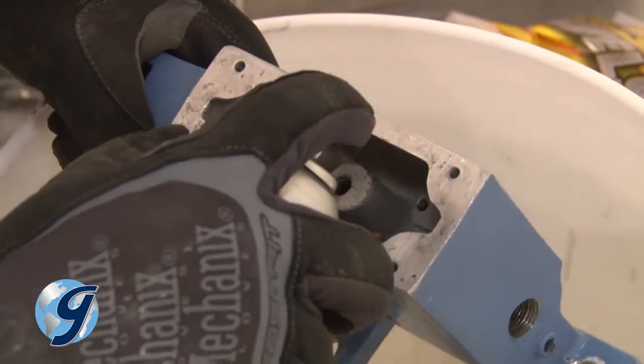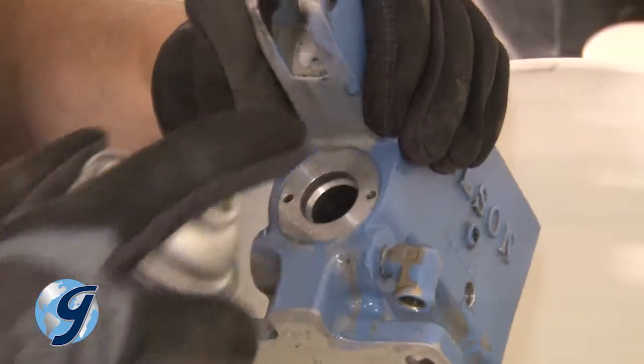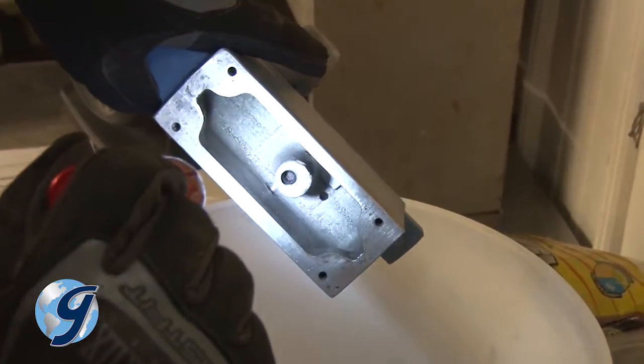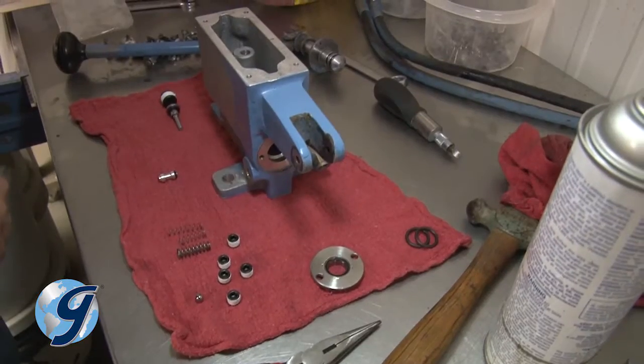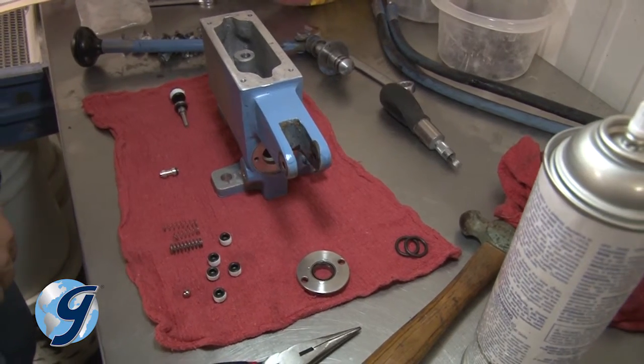Now that all appropriate components have been removed, clean all residue buildup from the pump. Next, inspect the entire pump to confirm that it is completely dry and free from dirt. Now you're ready to rebuild the pump using parts supplied from your Gilson Pump Repair Kit number 2.